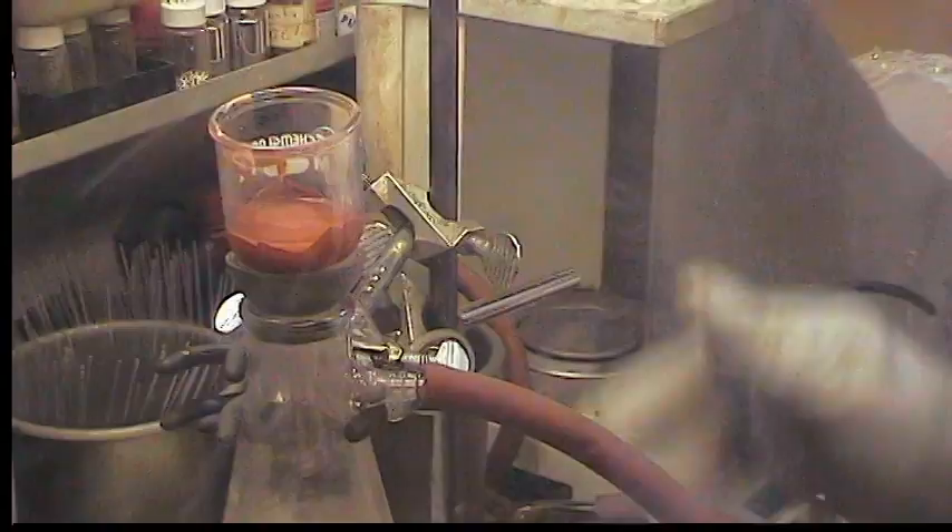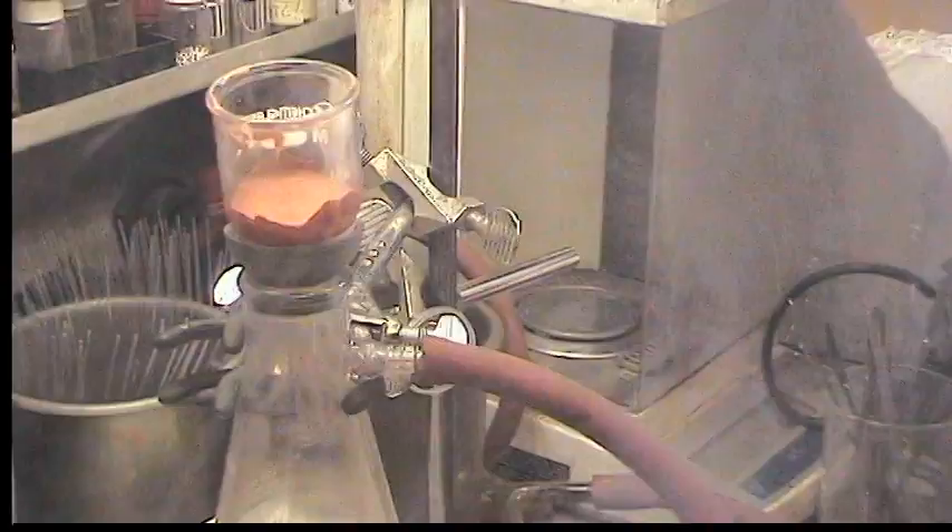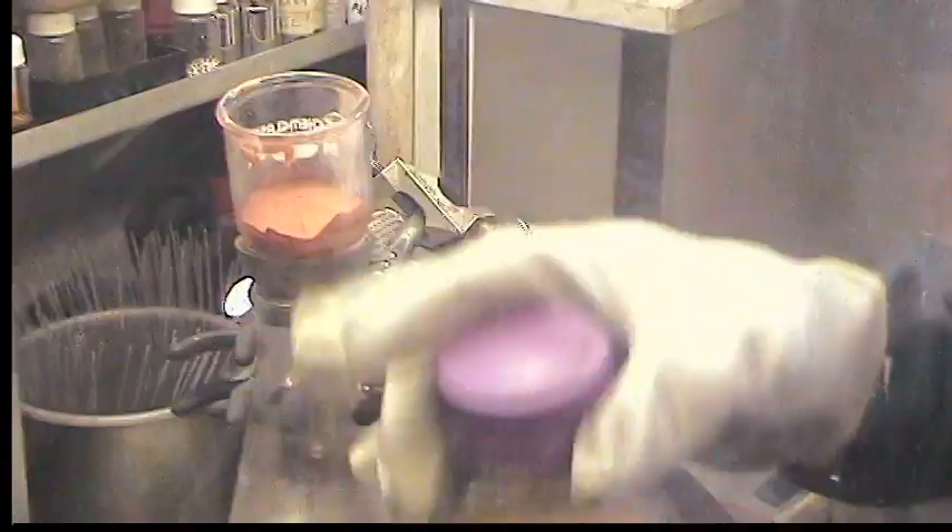During the part of the time when you were away, we just stopped the stirring so it wouldn't be stirring for four hours straight. I think we're done washing it with THF, but after washing with THF several times this substance takes a while to dry.